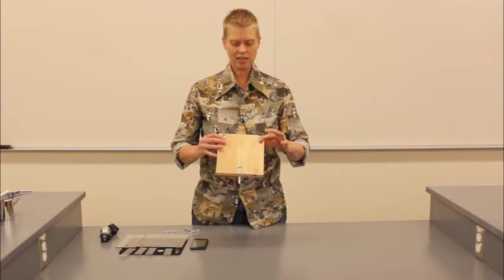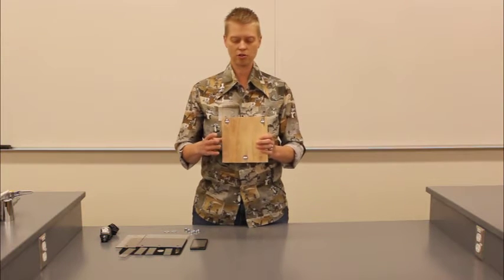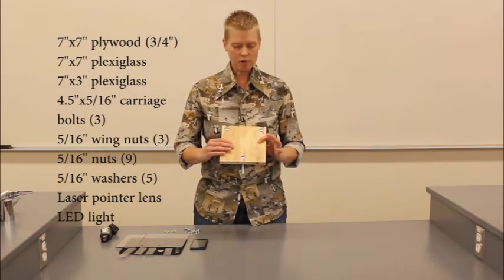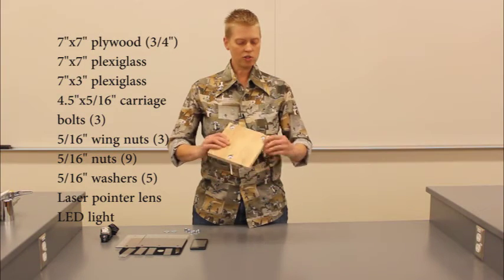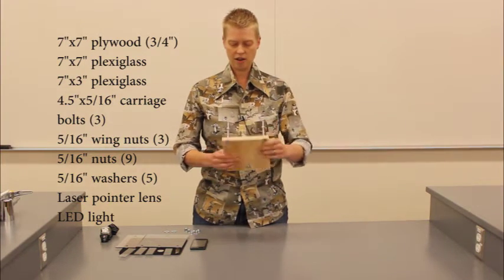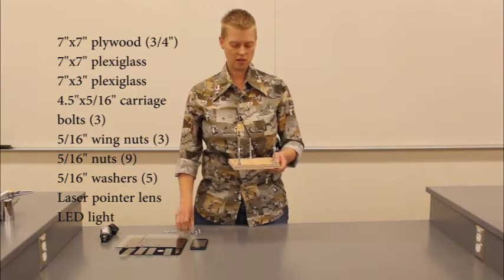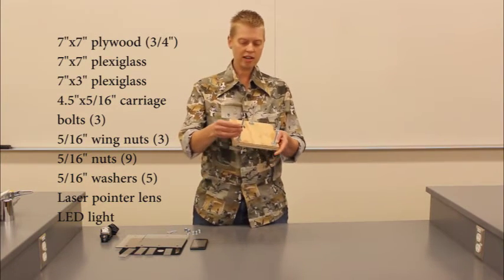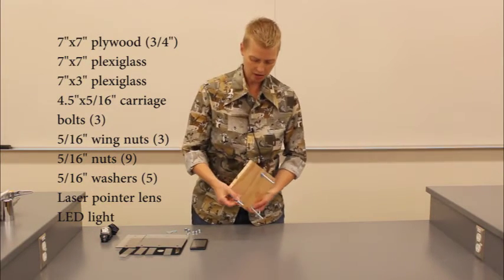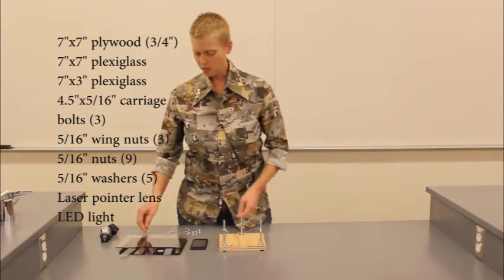To begin, you're going to need to get some plywood. We will have a list of these supplies, by the way, on this video for you to refer to later. But you'll need a piece of plywood cut in a 7-inch by 7-inch square, 3 carriage bolts that just have the round heads on them, several nuts, some washers, some wing nuts. The wing nuts are the ones that have the little levers on the side so that you can twist them. Some plexiglass.